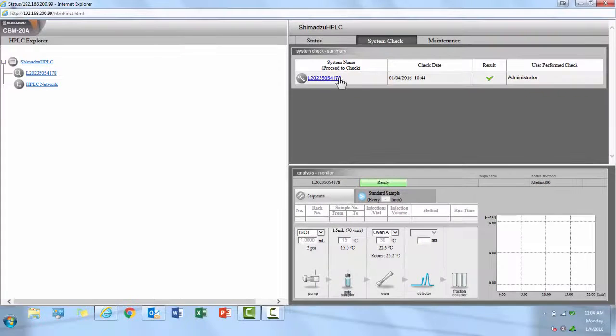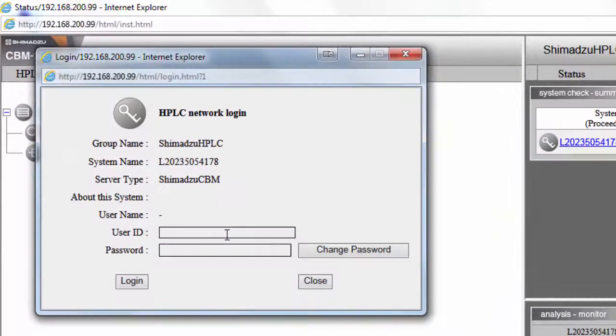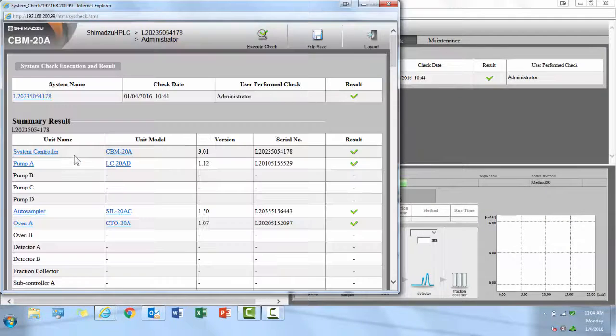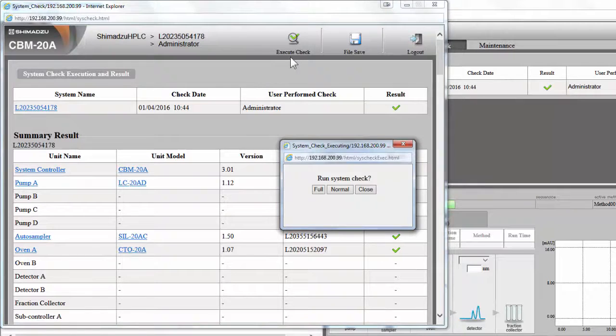To perform a system check, open the System Check tab, then click on the blue hyperlink below the system name. The default user ID and password are both admin, ADMIN, with a capital A. Once you have successfully logged into the system check, to perform a system check, click on the Execute Check icon in the upper right-hand corner.